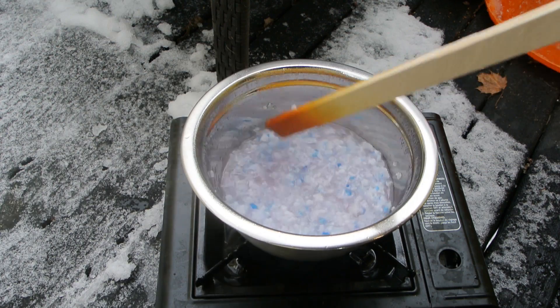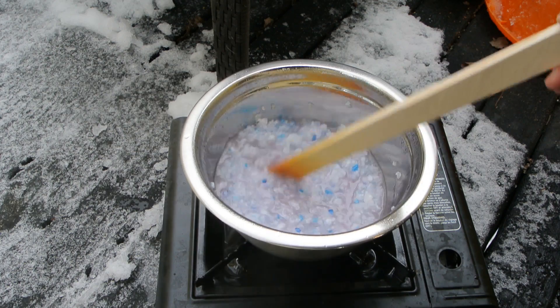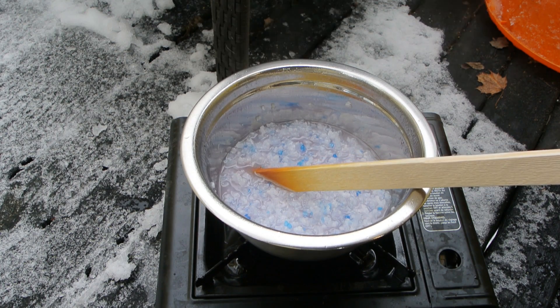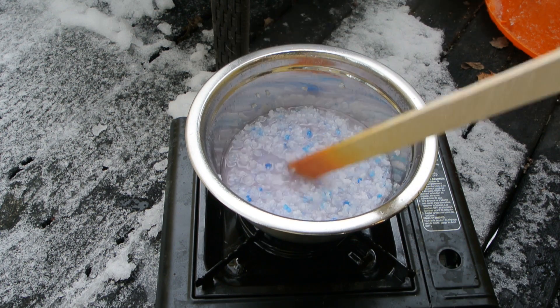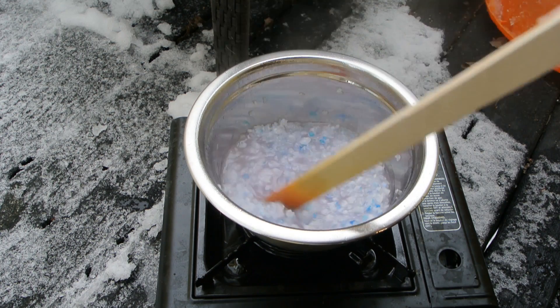I'm just going to keep stirring it. It's pretty hot too - generating a lot of heat. But I might have to add heat to it so this will fully dissolve.